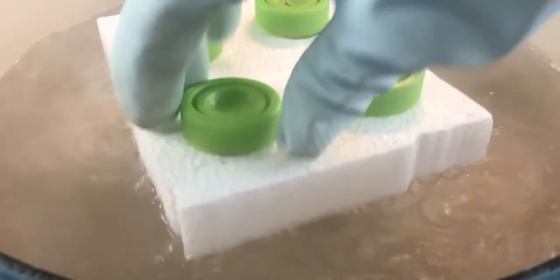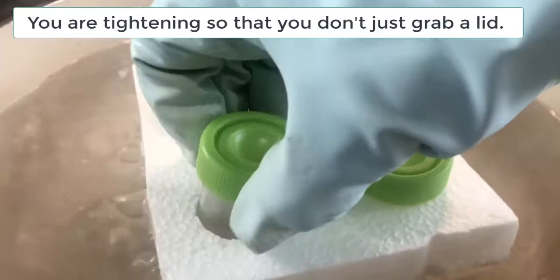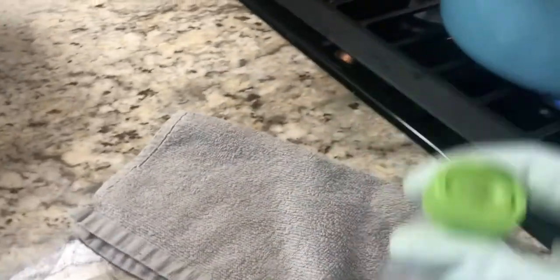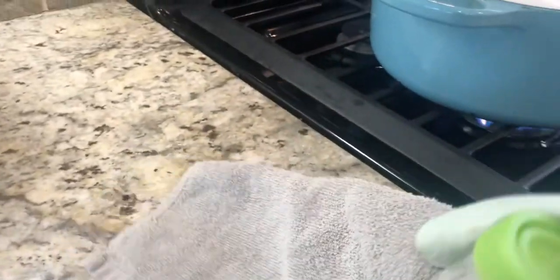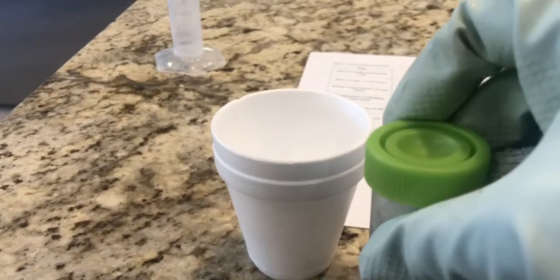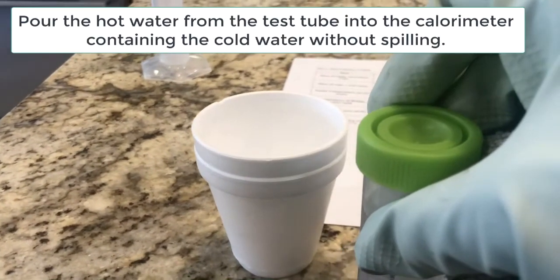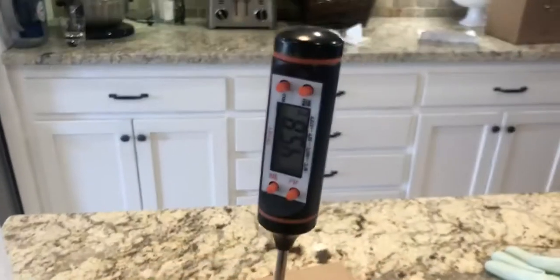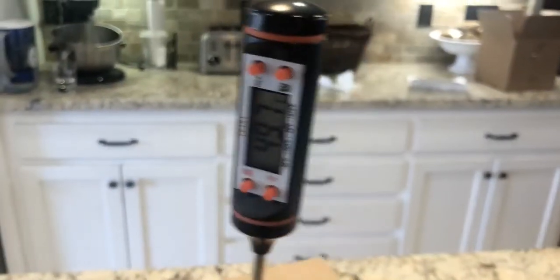Carefully tighten down one of the water caps if you can, and then protecting your hand, pull up that hot water. With the other hand remove the cap and then add it as quickly as you can but safely to the calorimeter containing the cold water. Now carefully swirl it until you reach a resting temperature.